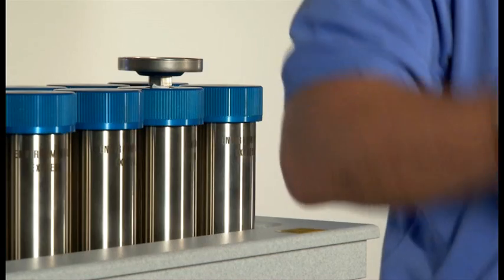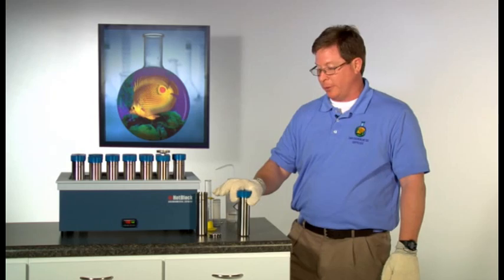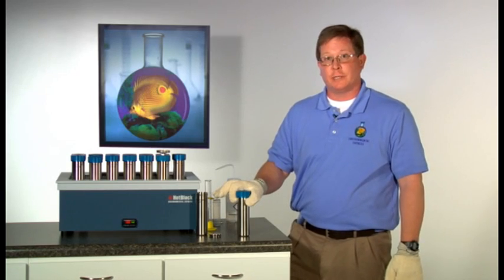After that heat time is finished, remove the soil cells from the block and allow to cool to room temperature. The cells will be hot, so heat-resistant gloves should be used.